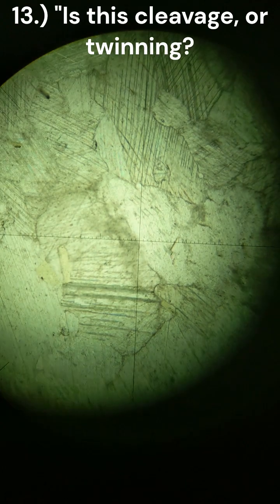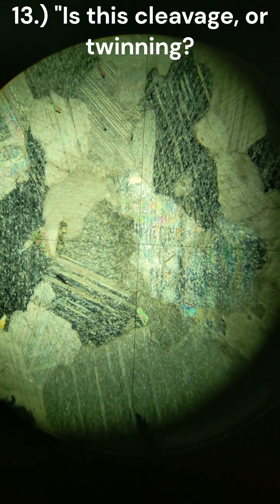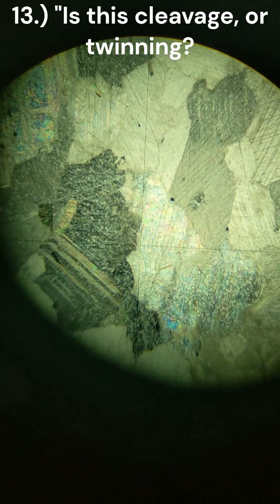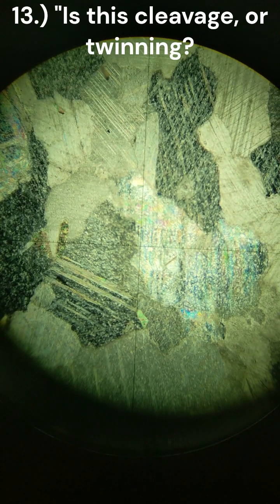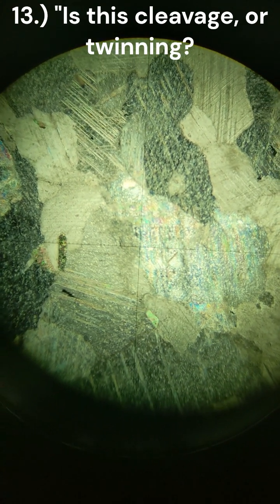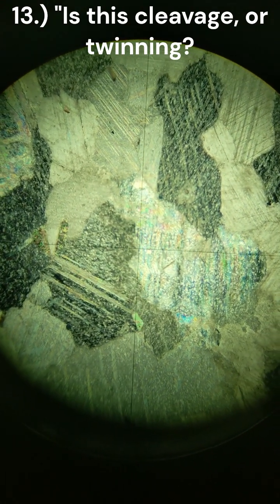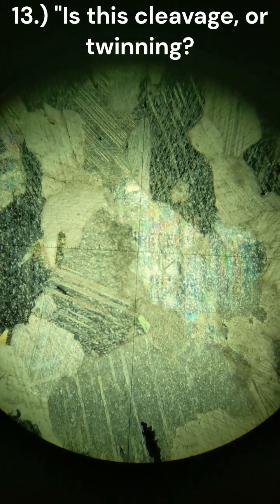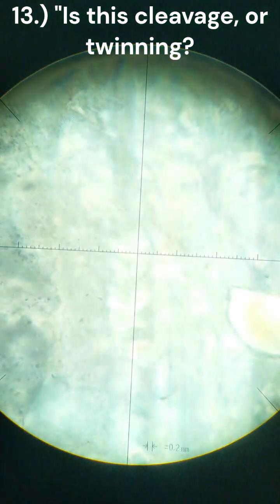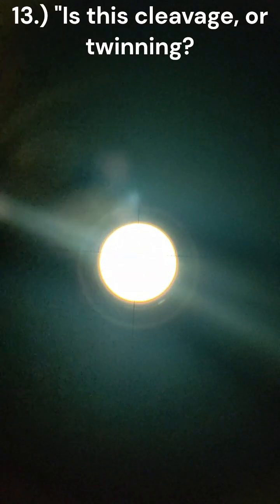This sort of, let me go and put it on crossed polars right now. I think this is cleavage because if it were twinning, I would probably see the calcite extincting at different angles rather than the entire mass, such as the northernmost blob right now. I'm going to shift it a little bit to the right. It extincts, the entire thing extincts at once, rather than, you know, bits and pieces. Going to go ahead and put it on 63 magnification, Bertrand lens on, and gypsum in.